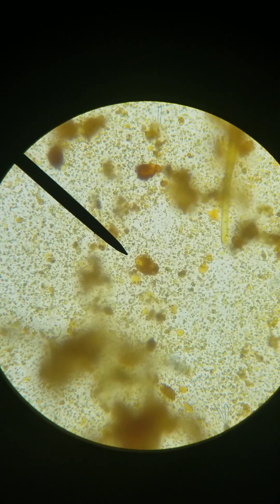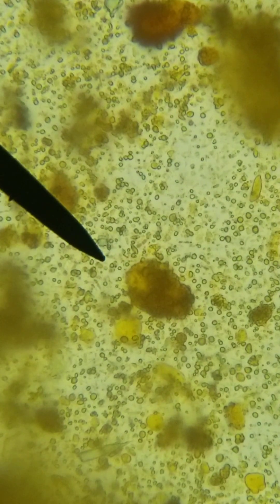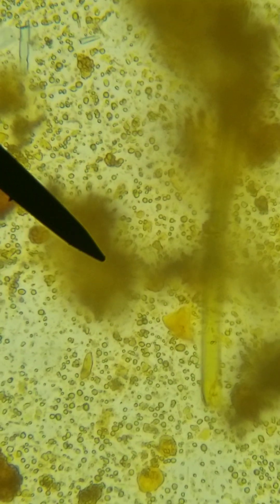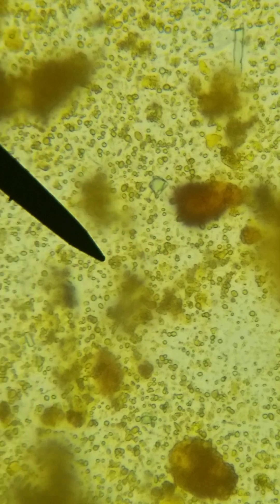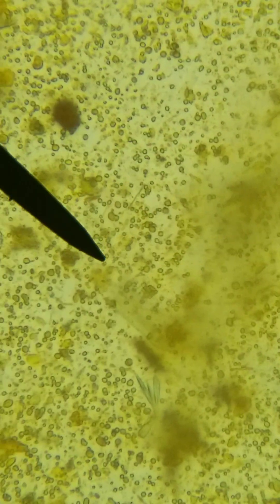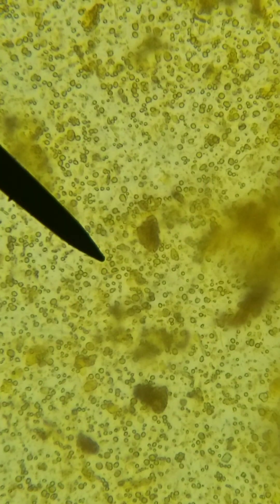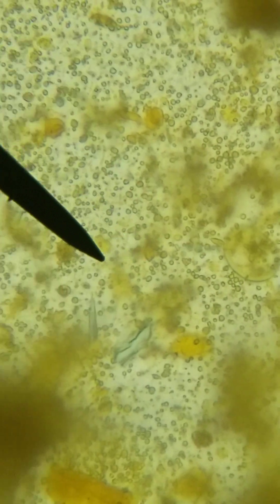So I'll describe the difference instead. The rhabditiform larvae of the hookworm has a longer buccal cavity and a shorter, smaller, tinier genital primordium — so it's the exact opposite of the rhabditiform larvae of Strongyloides, which has a short buccal cavity and a much larger genital primordium.